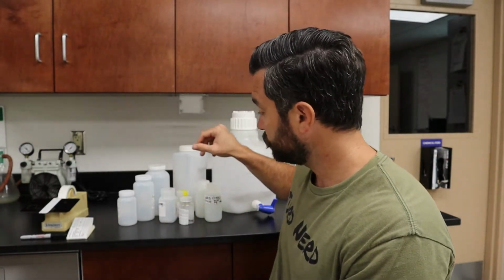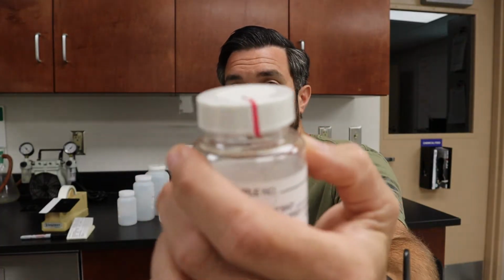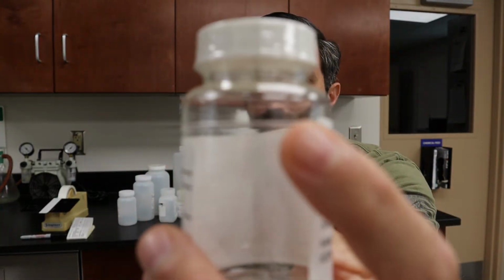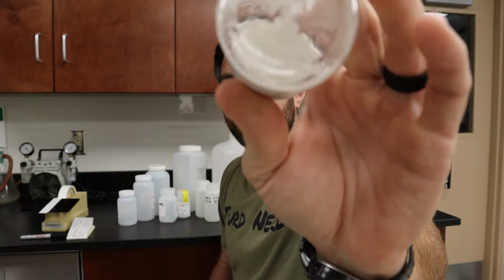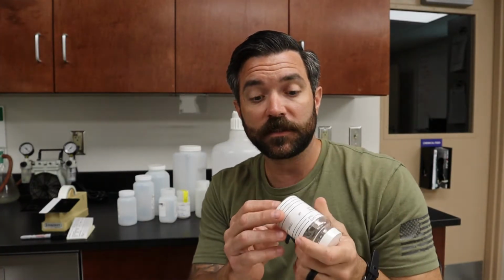Very, very important. Also, regarding sample bottles, this here is a small little fecal bottle. It has this little fill line right there at the 100 ml mark, and it also has the seal on the top. So I know that whatever is put in here, which is normally the sodium thiosulfate, normally inside your fecal bottle you will find some powdery substance, or you will see a small little pill, what it looks like.